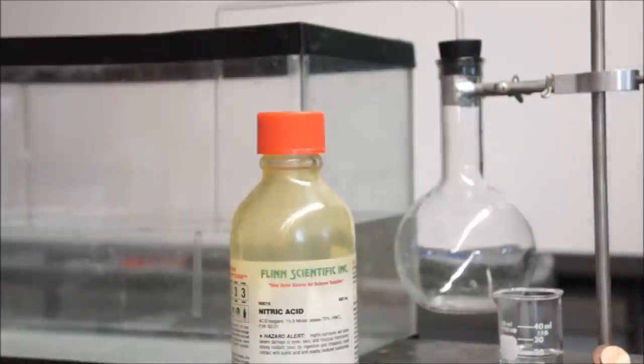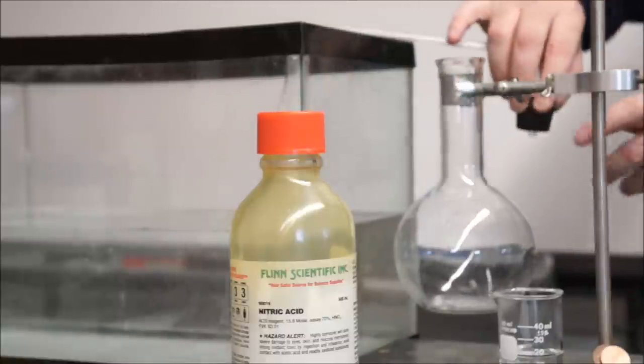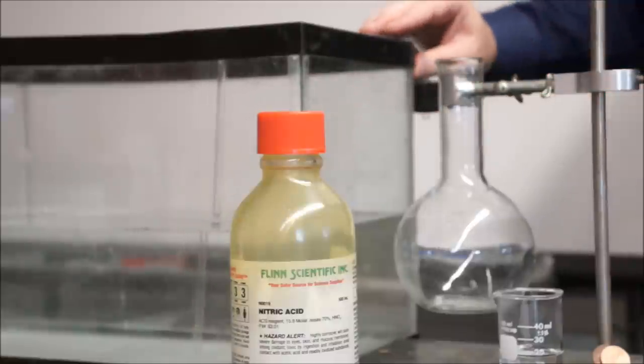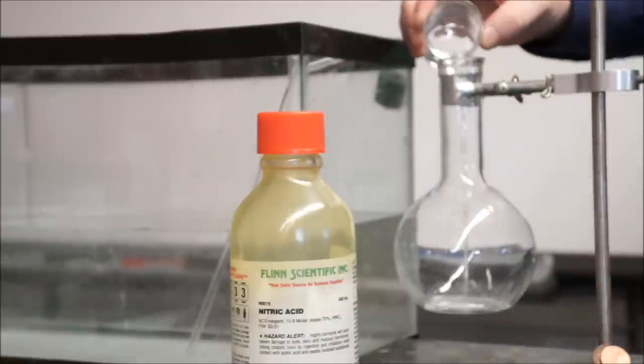This is the penny operated nitric acid fountain. So what you do is you have your concentrated nitric acid and a couple of copper cents. What I'm going to do is I'm just going to pour the nitric acid in the flask.